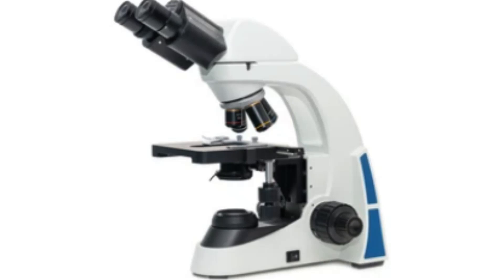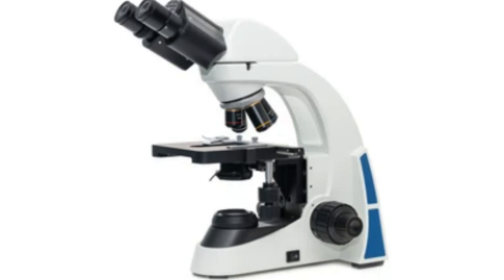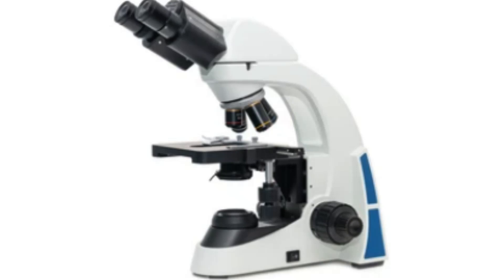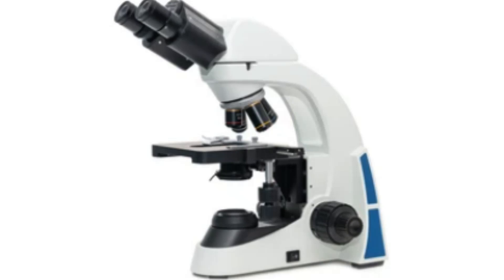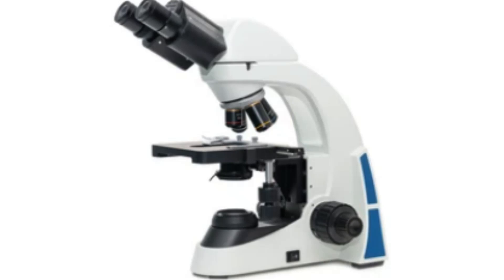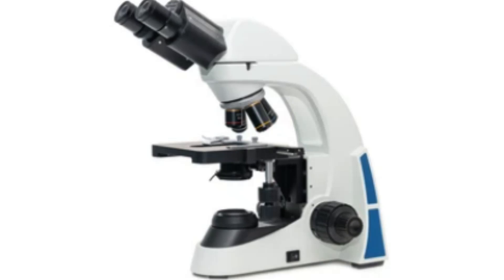By controlling the orientation of the polarizer and analyzer filters in the microscope, the geologist can observe how the light interacts with the sample, revealing important information about the mineral properties.